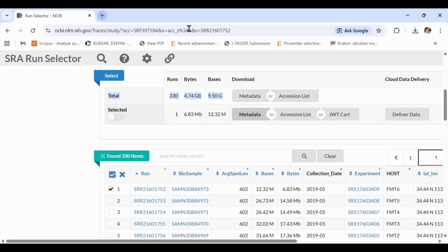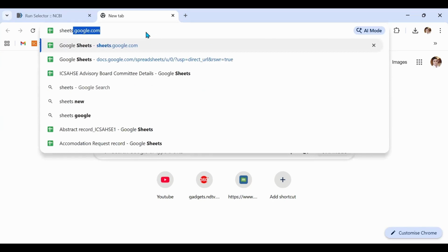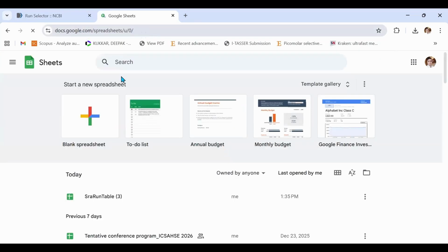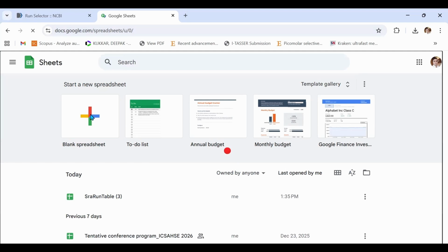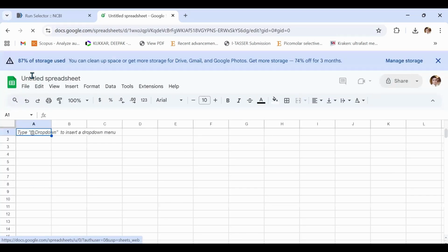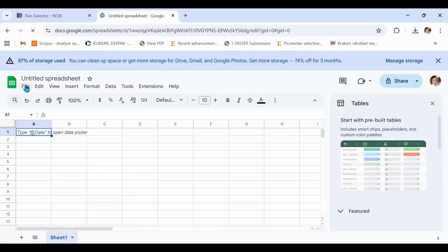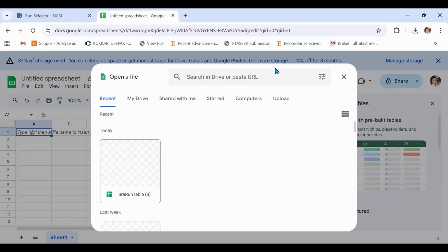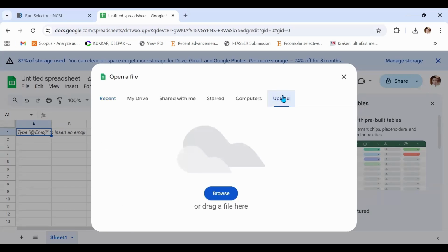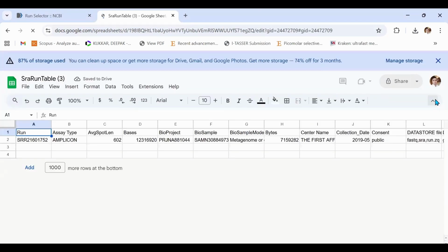Once you have downloaded your sample metadata file, in your browser page, type sheets.google.com. You will see various options. From this, click on the blank spreadsheet. Once you have selected this, a blank sheet will open up in a few seconds. Click on the file option, then click on the open button as shown on your screen. A box will open up. From this, select the option called upload. Click on the browse option. Go to your download folder. Select your QIIME metadata file, and you will see that your metadata file is now open.